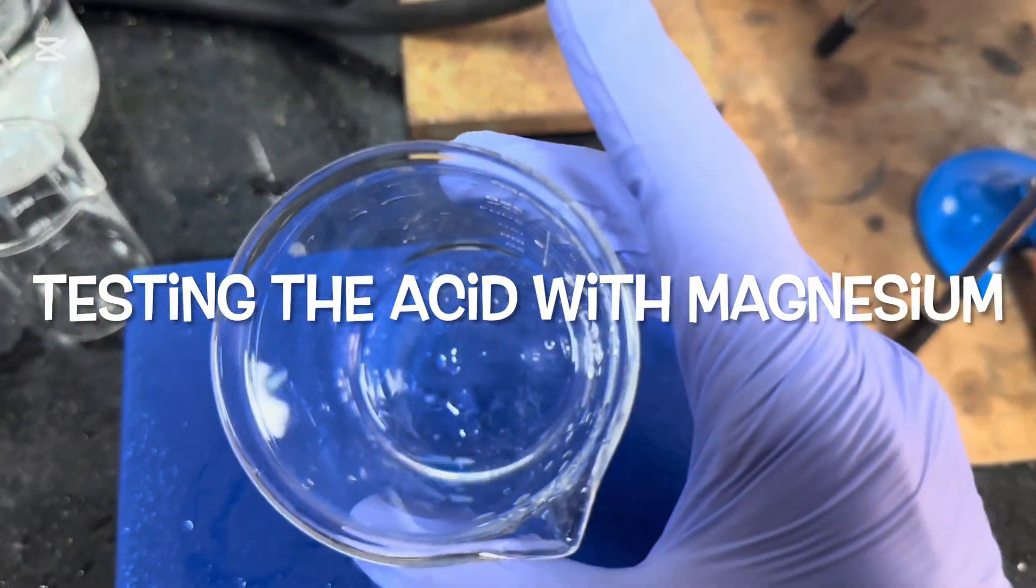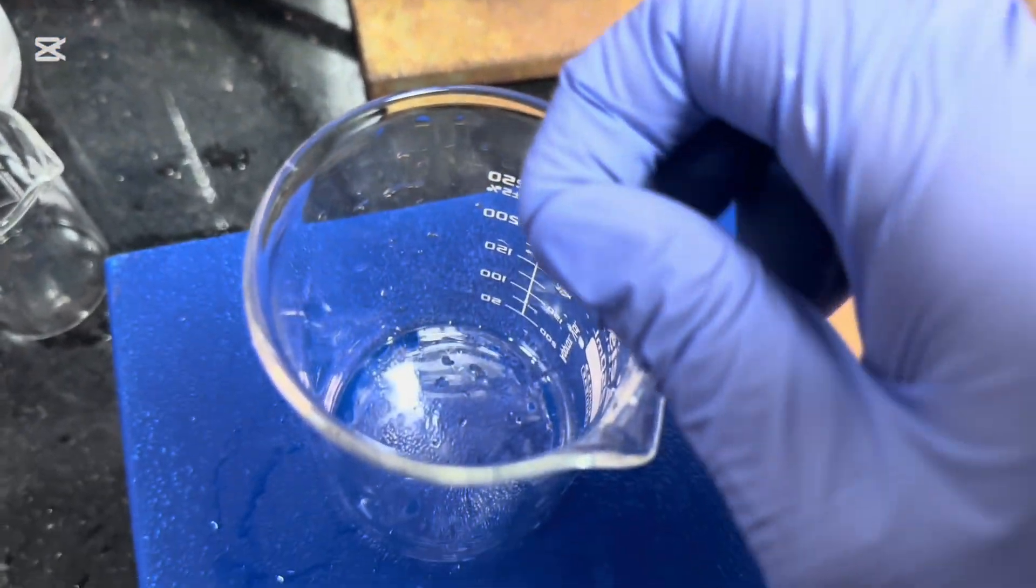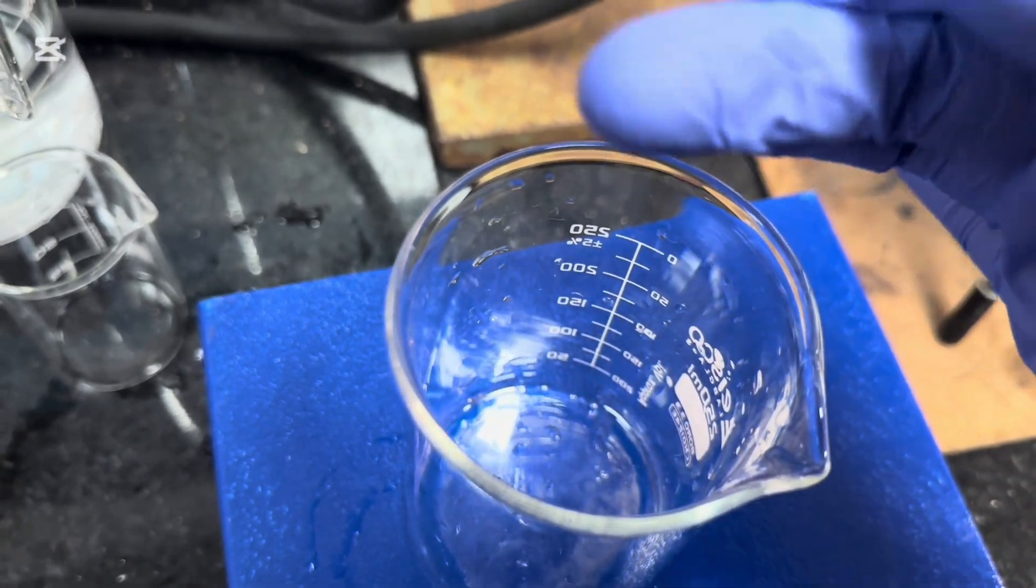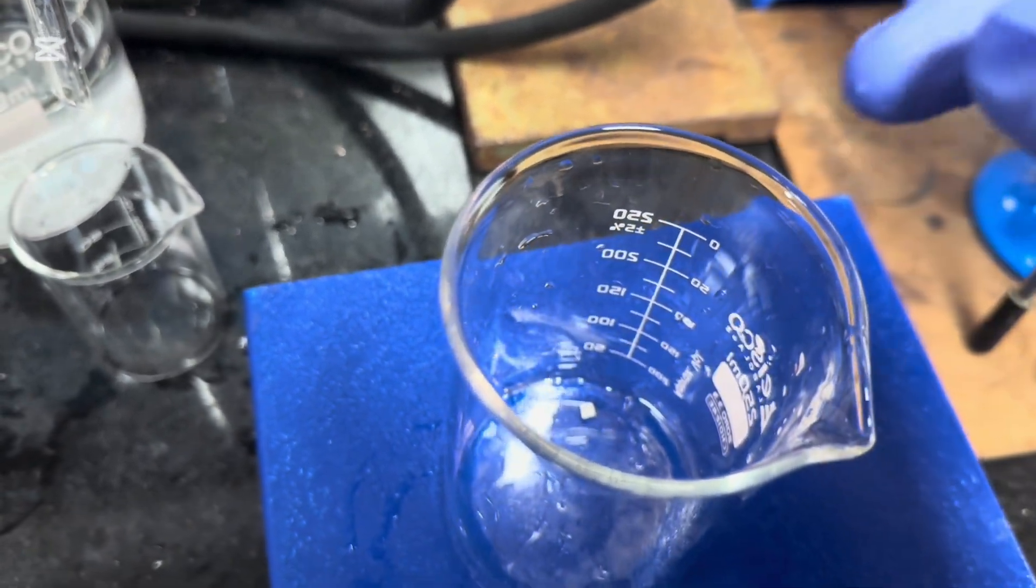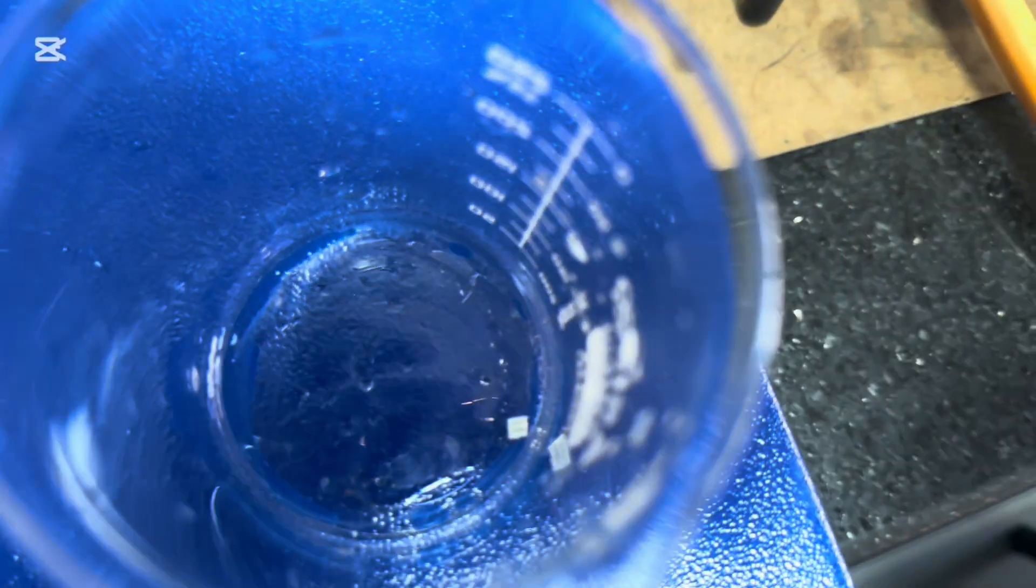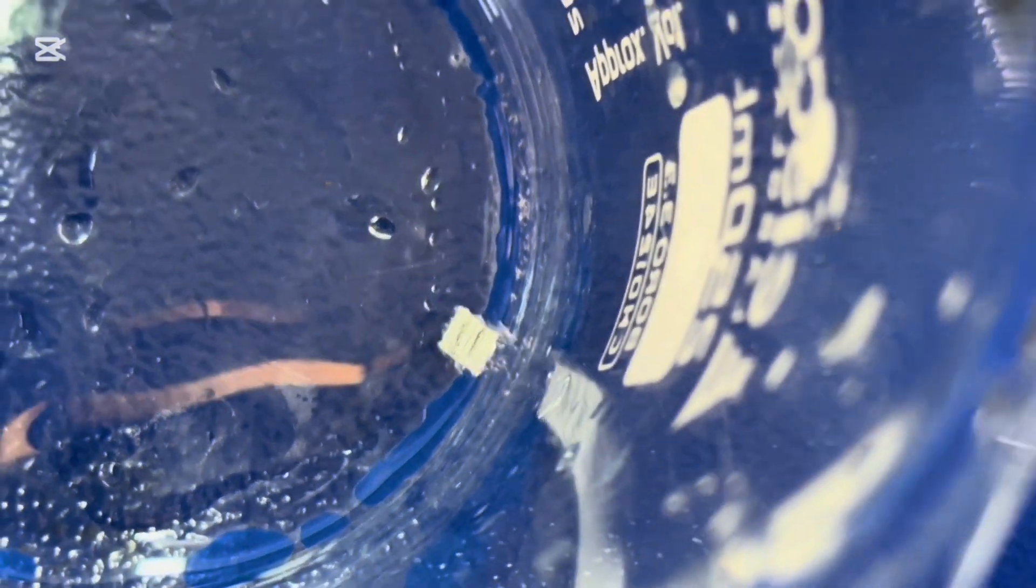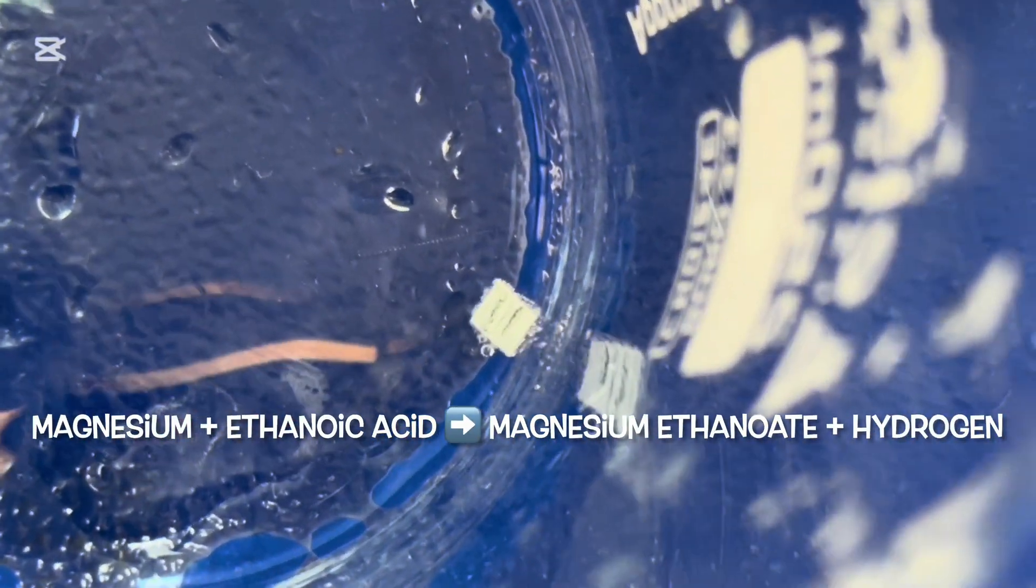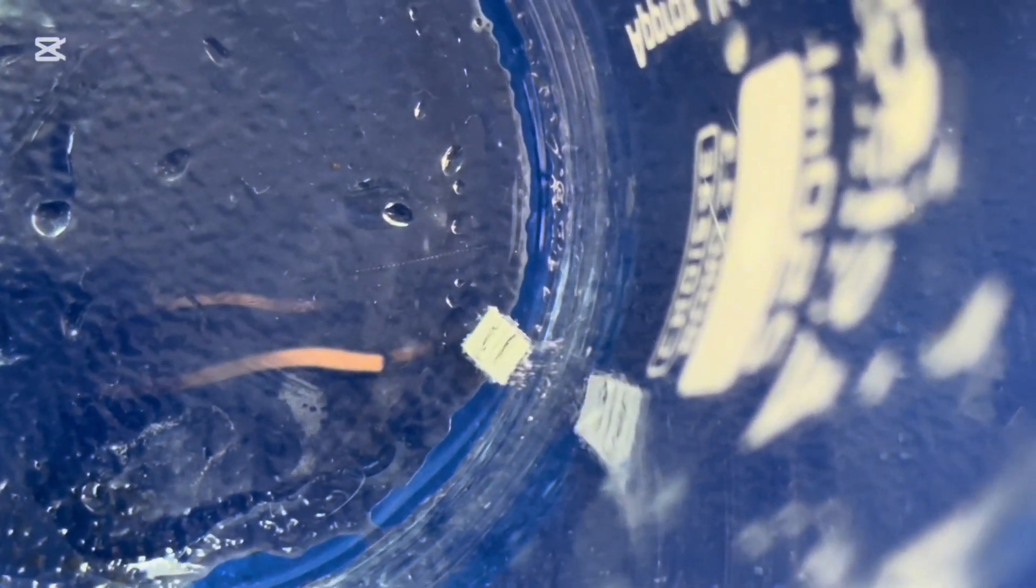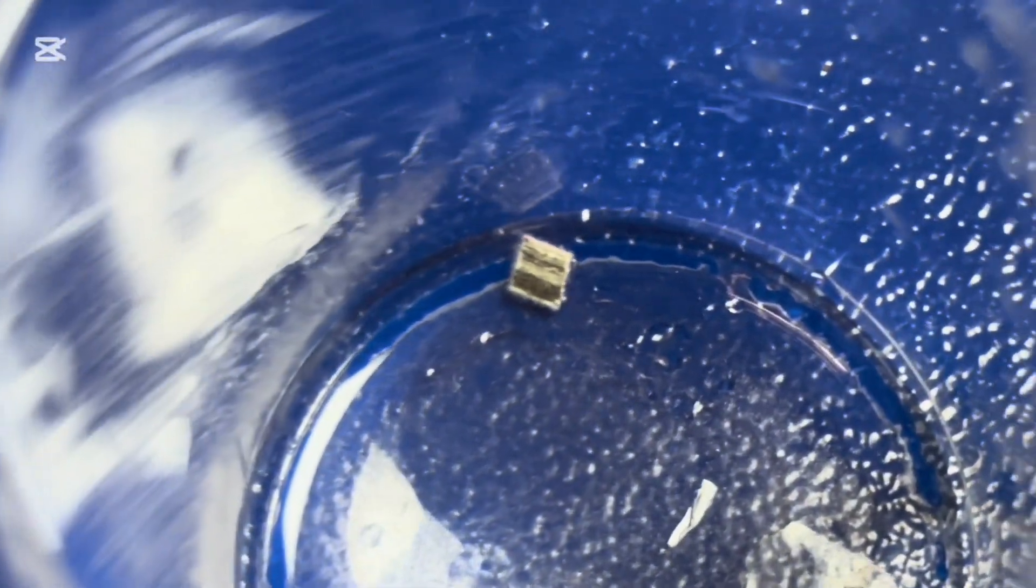Okay. So just give this sample a try. Here's the magnesium. I'm just going to pop that in. I've got a problem just popping it in actually. There we go. And you can see it's fizzing. I'll just zoom in there. What's great about it is that it's actually taking the layer of residue off the magnesium. So it's making it really nice and shiny and clean. Can you see that? Yeah. So you won't get this with the aldehyde. Okay. So if the ethanol was added to magnesium, you would not get any fizzing.